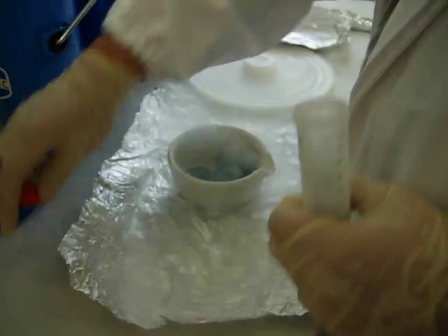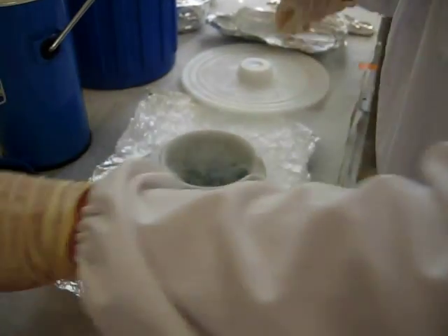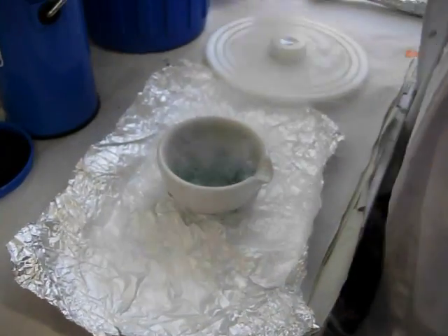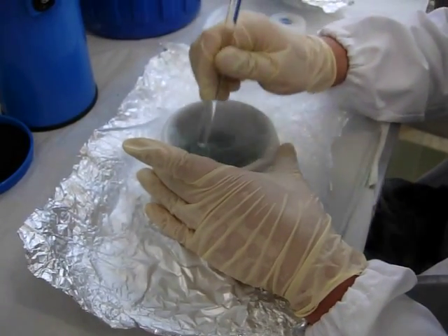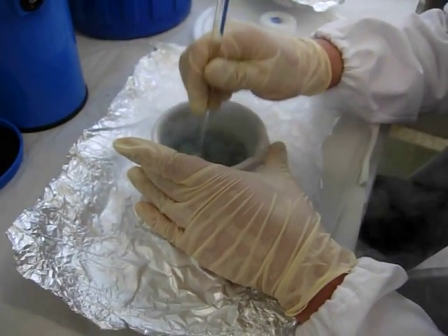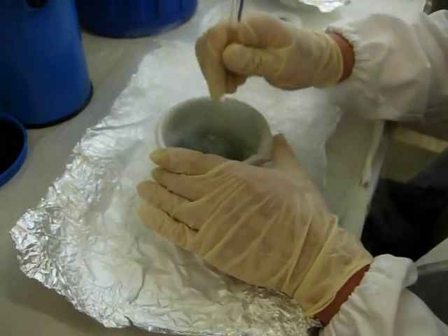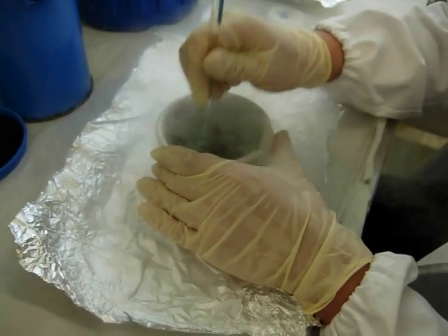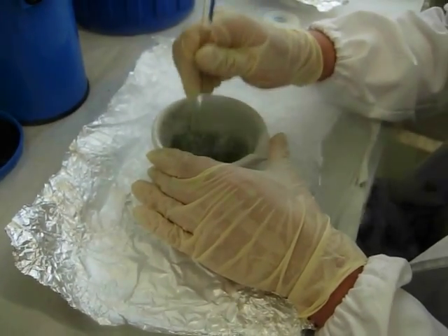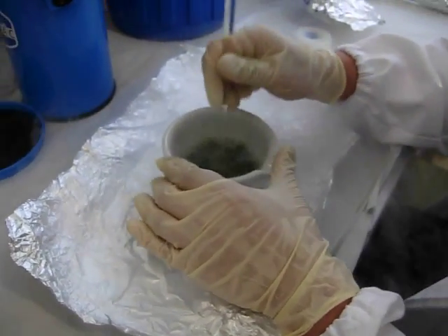The tissue is still frozen, so what I do is crush it. The middle veins of the leaves are the most difficult because they are thick, and you have to pay special attention when you grind them — if you don't grind them properly, they don't give material.